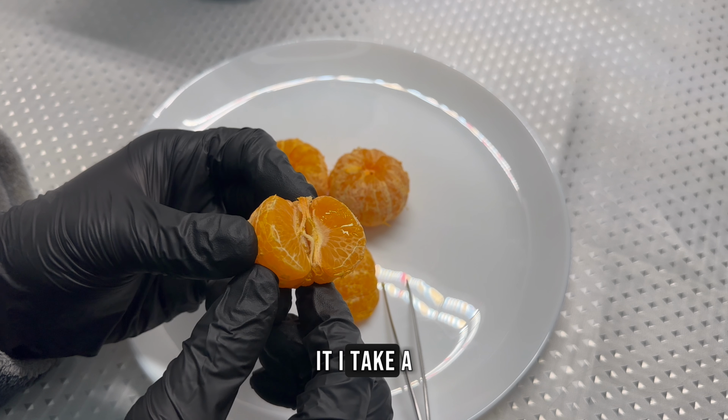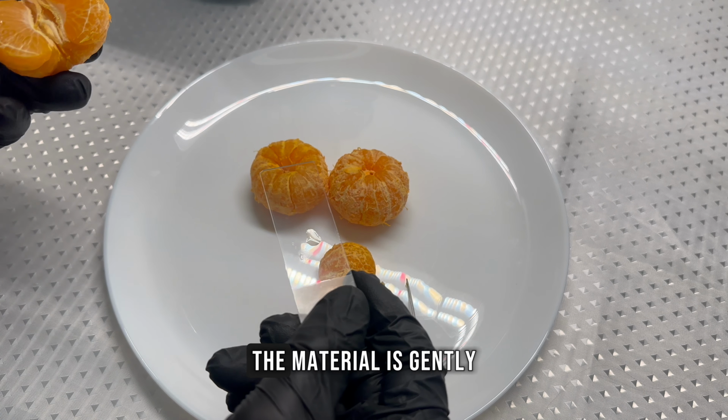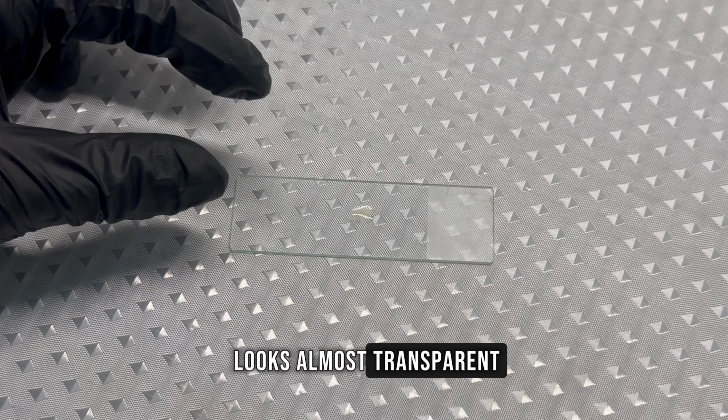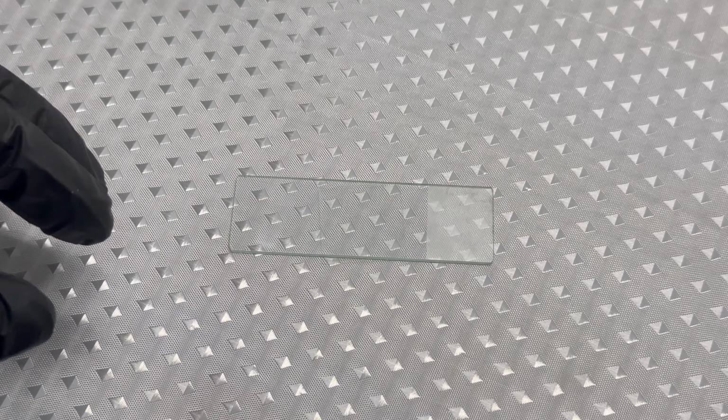To explore it, I take a small piece of mandarin and prepare a thin sample. The material is gently spread onto the slide. Under normal light, it looks almost transparent. Nothing unusual stands out at first glance.